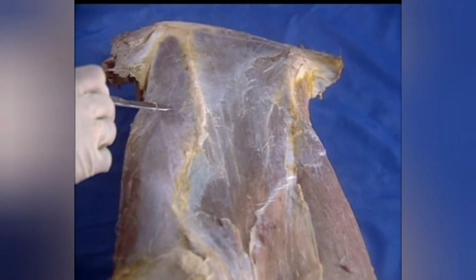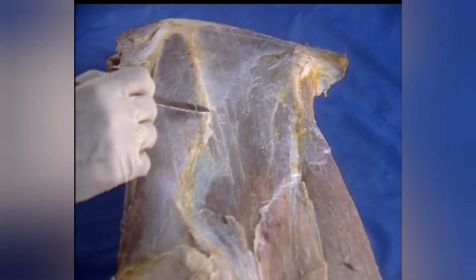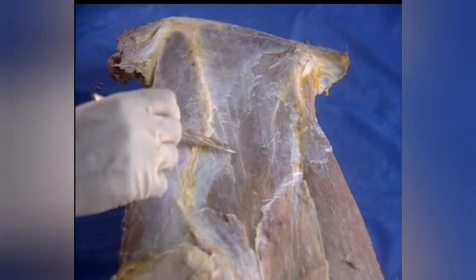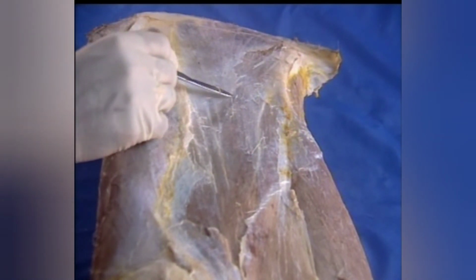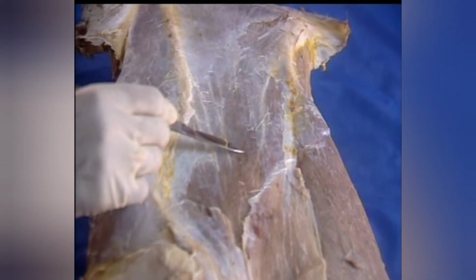This region is the shoulder lateral region. This is the scapular spine, and the muscle situated behind this is the infraspinatus muscle, and in front of the spine is the supraspinatus muscle. This is infraspinatus muscle which occupies the infraspinous fossa behind the scapular spine. Lower part of this muscle is covered by the deltoideus muscle.